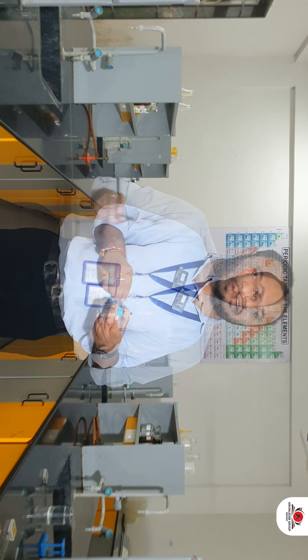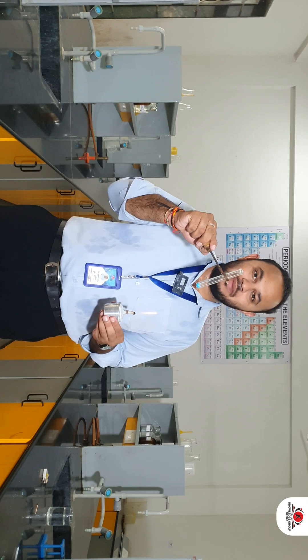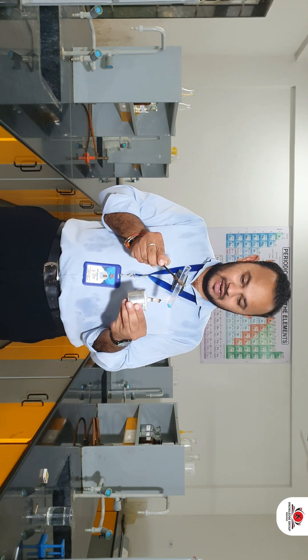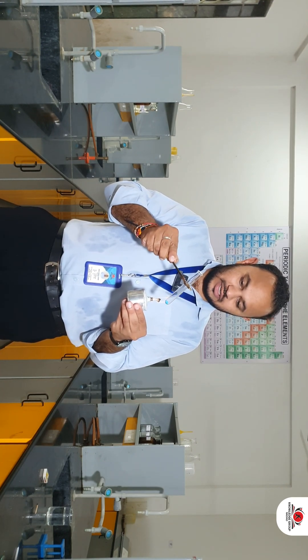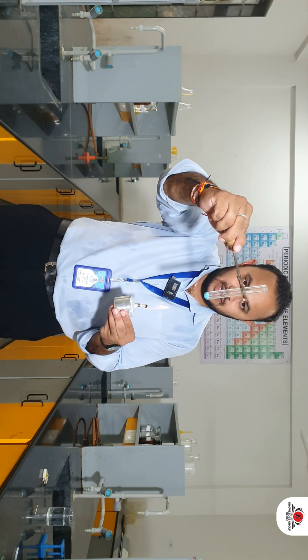To find the answer, I will heat some copper sulfate taken in a test tube. Make sure that the test tube is dry — there should be no water molecule present in the test tube. Then I will heat the test tube which already contains copper sulfate crystals.